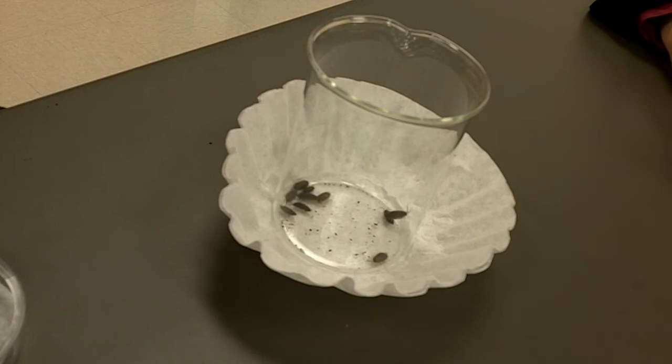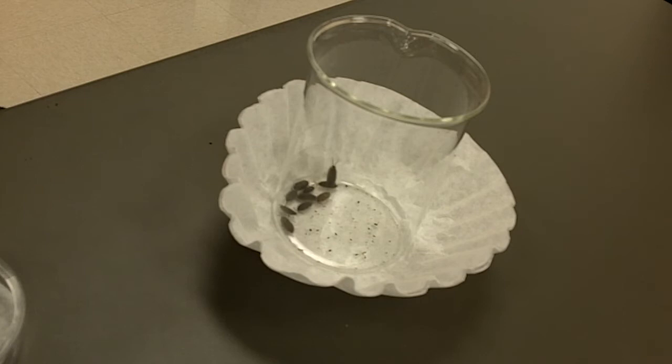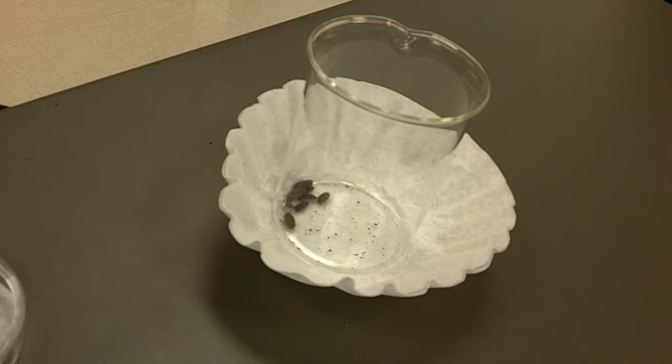So let's move to S3, activity A2. Now, technically this is about orientation behavior, but let's talk about making a hypothesis before we get started. It says we're going to observe isopods as they respond to humidity differences in their environment over time. The procedure is basically you've got your chamber set up and you'll put five bugs on each side. But before we do that, we'll saturate one side of your chamber with a certain number of drops.